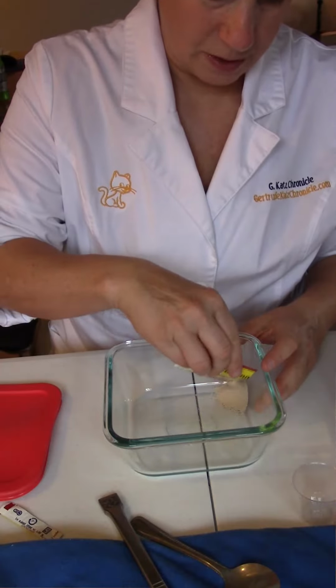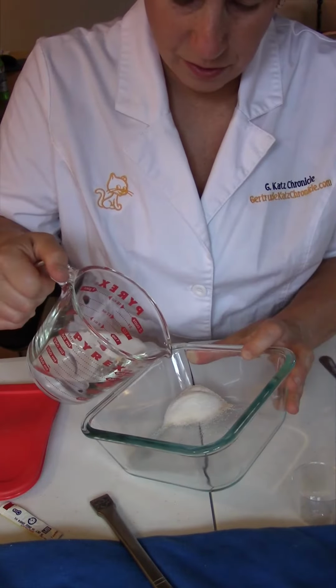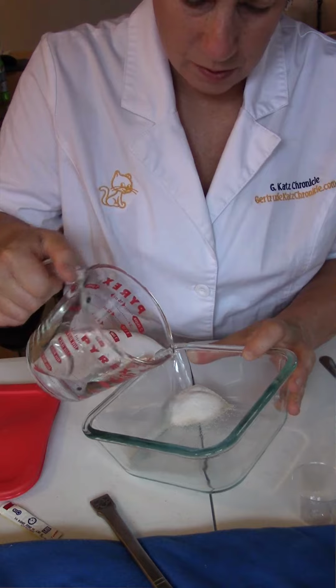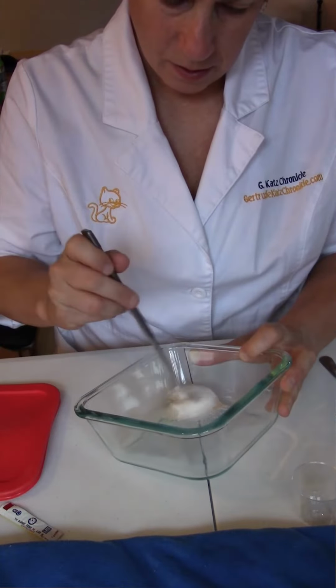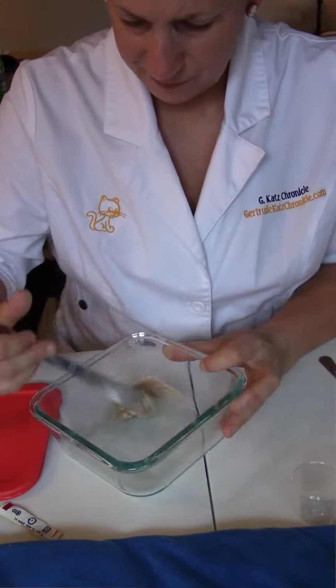Yeasts and a few other microorganisms use alcoholic fermentation to release energy from food. To demonstrate this process to students, open a yeast packet up. You can add about a packet or a teaspoon of sugar for food, water. Yeast survives best with a little bit of moisture. That plus heat will make the yeast react, and it will bubble up and produce gases of carbon dioxide.